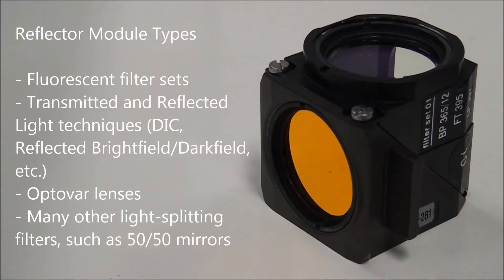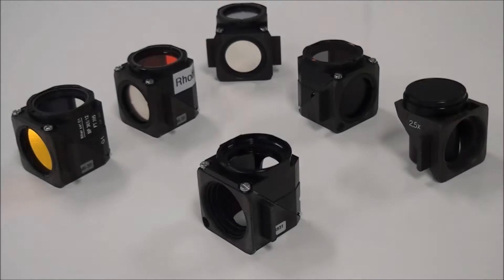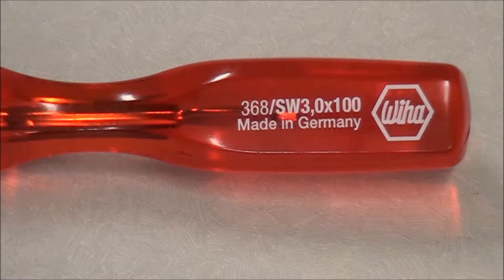Occasionally, it is necessary to know how to access these cubes. For this video, you will only need your hands and a little patience and care. A 3mm hex screwdriver will be needed when working on Axio Examiner and Axio Scope models.